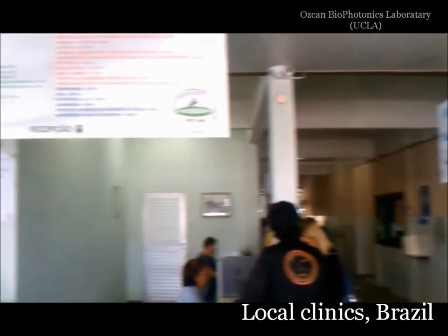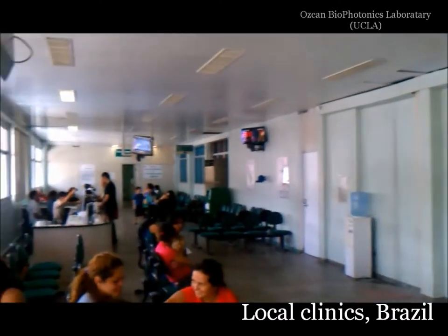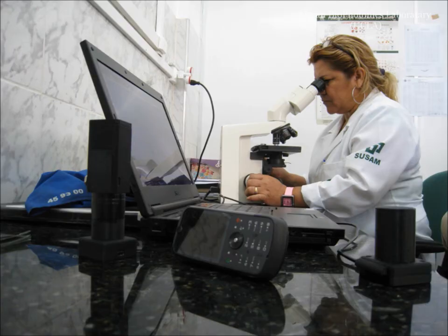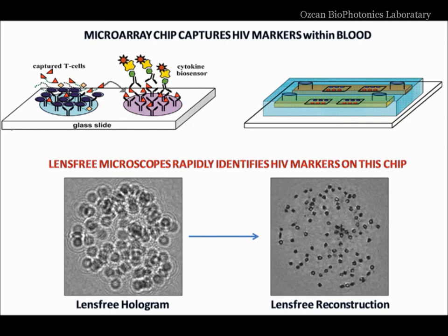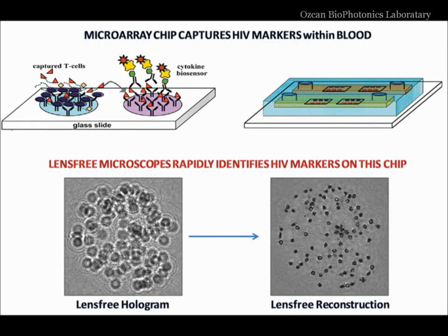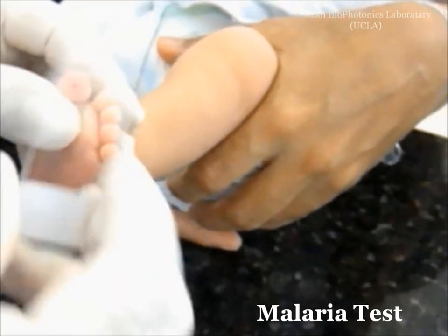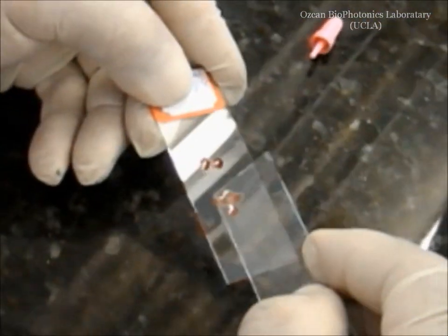These automated lens-free microscopes can be very useful, especially in resource-limited field settings of developing countries which suffer from many infectious diseases and epidemics. For instance, using state-of-the-art microfluidic devices, it can identify HIV markers in blood samples within seconds. Just like HIV, you can also analyze malaria-infected blood samples, even in the most remote parts of the world.